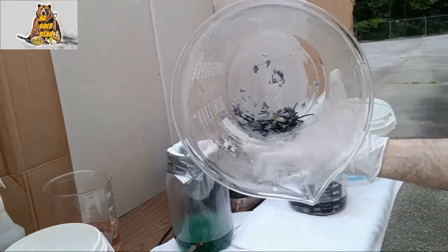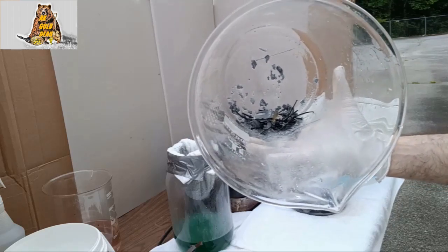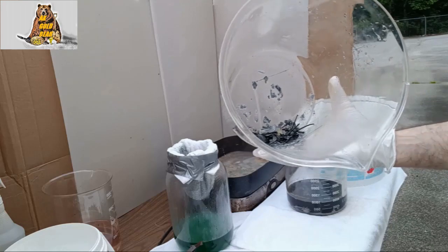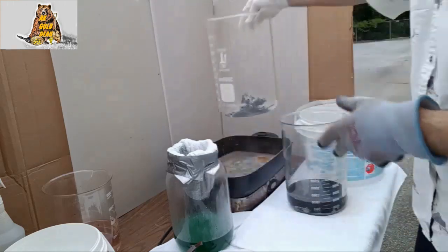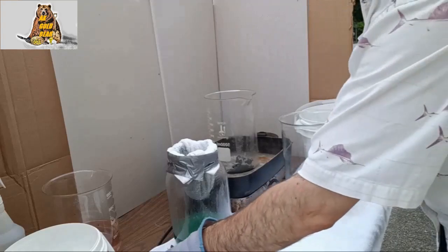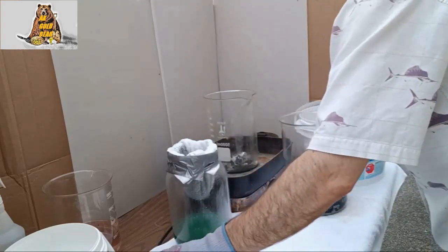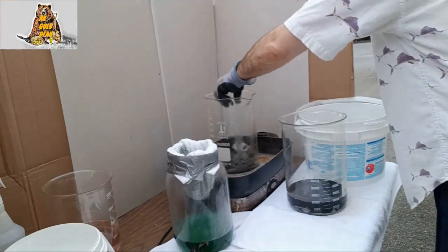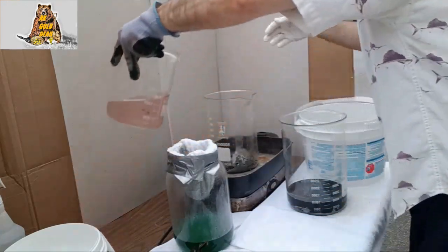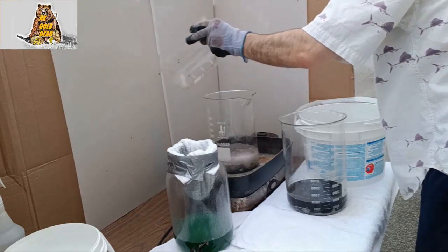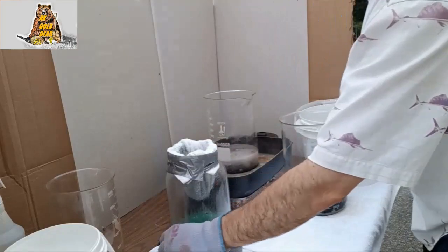Here some nails some steel and this is still good material to make iron sulfate. Just add more steel and fresh acid and keep going.